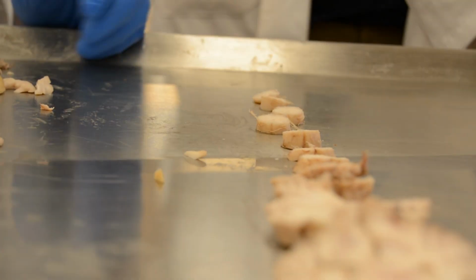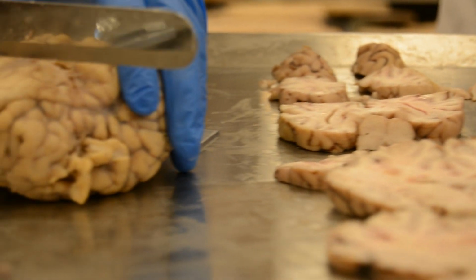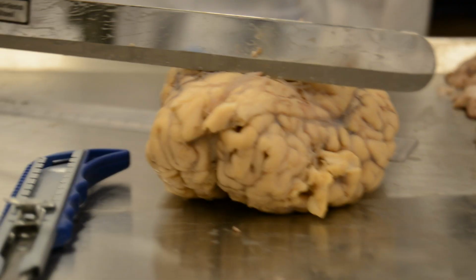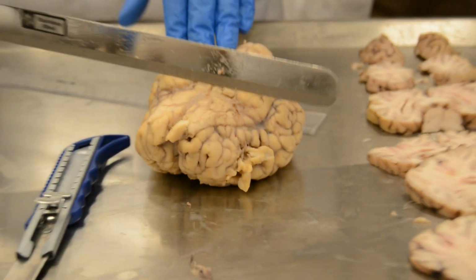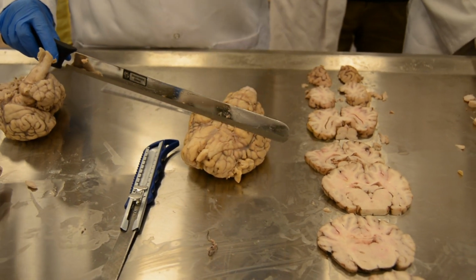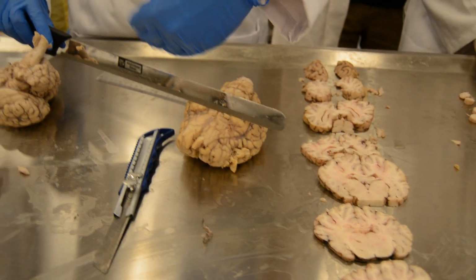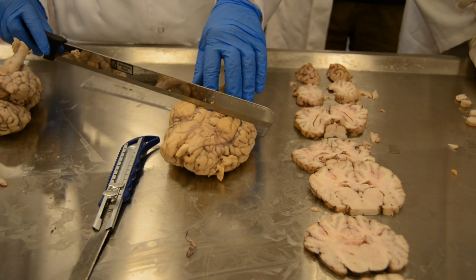So we took our first cut at the level of the temporal tips. In humans I appreciate the tips of the lateral ventricles, but here I found the basal ganglia emerging. The second cut is at the level of the optic chiasma. It's very close here in a cow's brain, but in a human brain I'll find 2 to 3 sections difference. I will take 2 to 3 serial sections between these two. Then the third cut is at the level of the mammillary body.